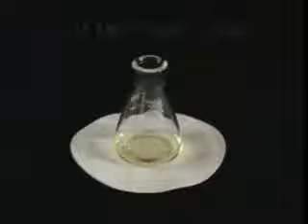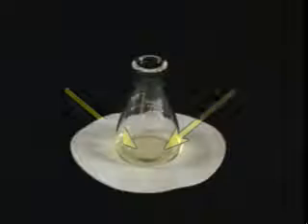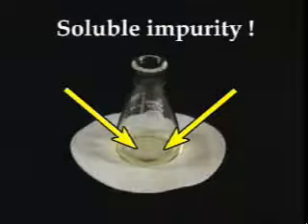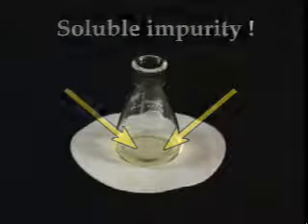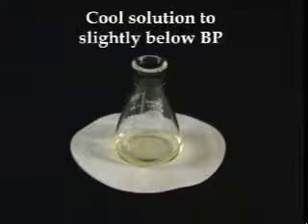Now that the sample is in solution, impurities can be removed through decoloration and hot filtration. Take a close look at the solution. Is it the right color? For example, if you're expecting white crystals and your solution is yellow, then there is a soluble impurity. One easy way to remove small amounts of colored impurities is with activated charcoal. Before adding any charcoal, cool your solution to slightly below the boiling point. Caution! Adding charcoal to a boiling solution will cause it to boil over.